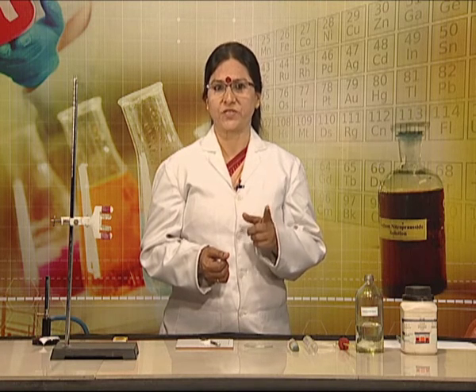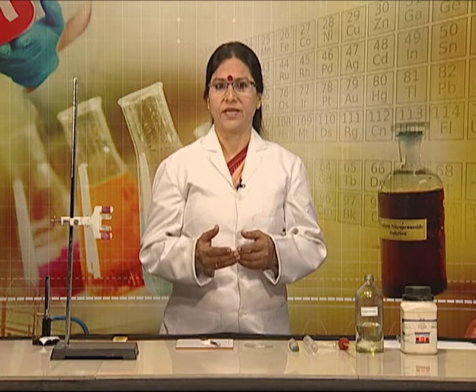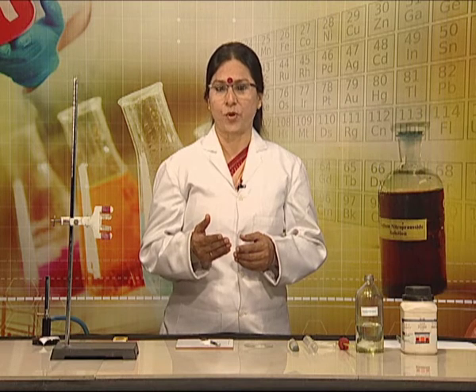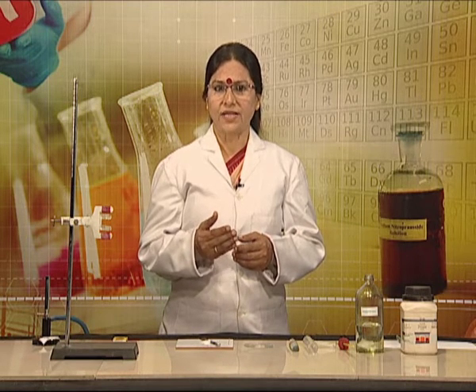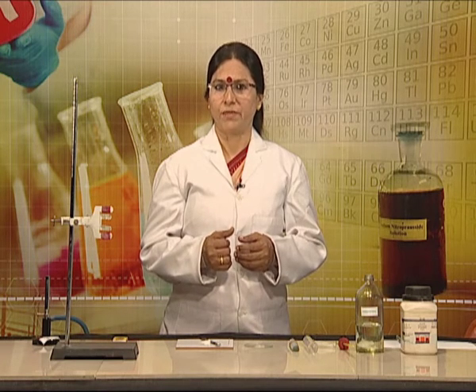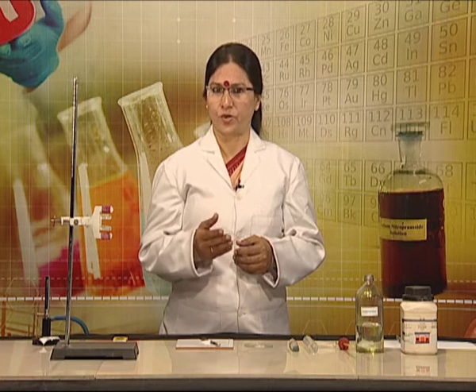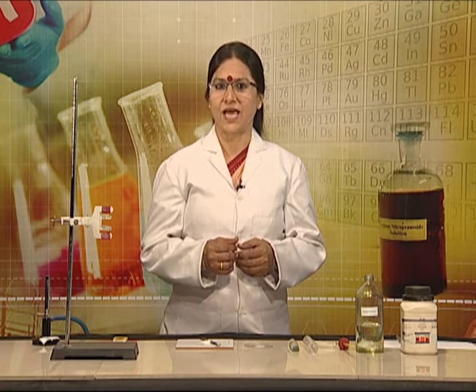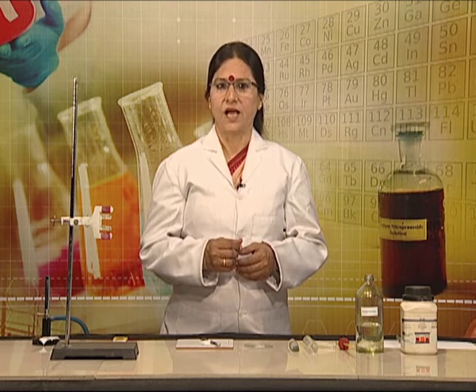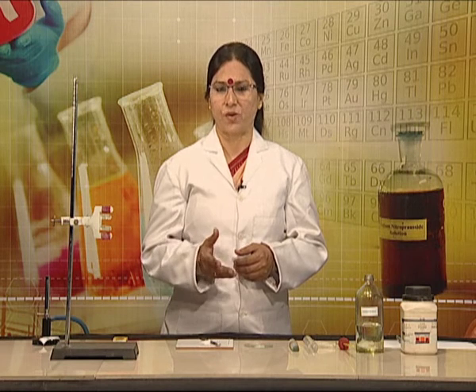At one atmospheric pressure, as heat is applied to a solid, its temperature will increase until the melting point is reached. At this stage, the temperature becomes constant. The melting point can be used as an indicator of purity because a pure substance has a sharp melting point. Let us learn how to find the melting point of a solid organic compound.